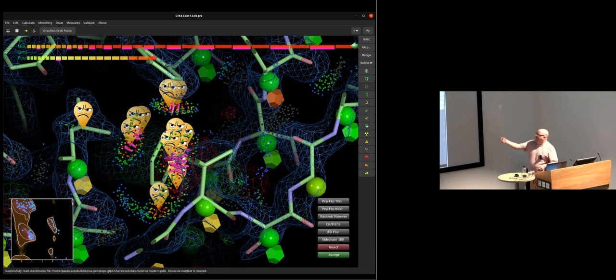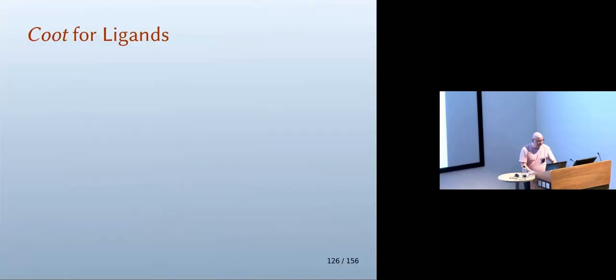if you rotate the view, you can see this is the wrong rotamer. I will just flip the rotamer here, using Backrub rotamer, and it will flip into the right place, and, well, maybe we'll have a chance to do that in a demo, and the unhappy faces will disappear.